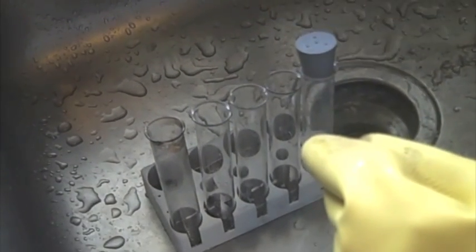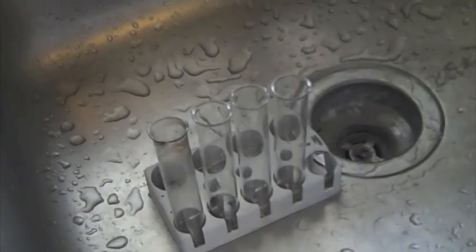So there's the mixture of chemicals and I'm going to add about two inches of distilled water. So there's the solution and mixture, and now I'm going to shake it.